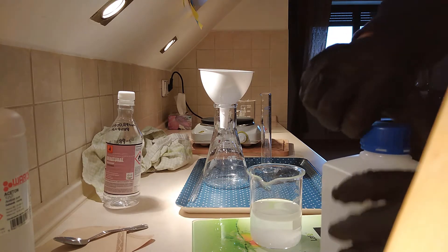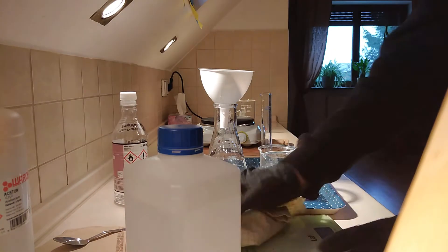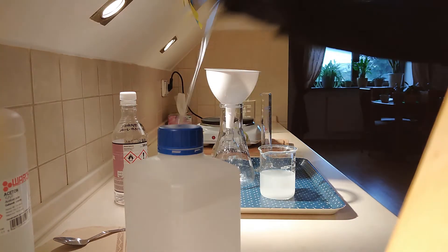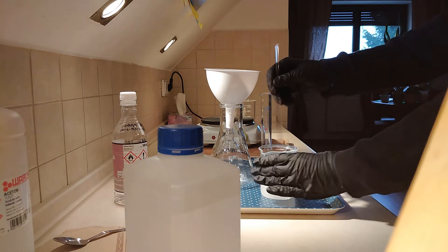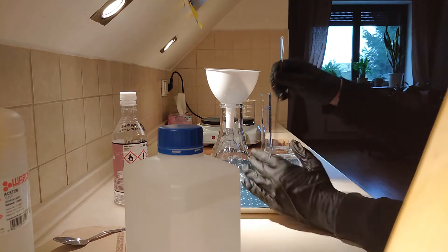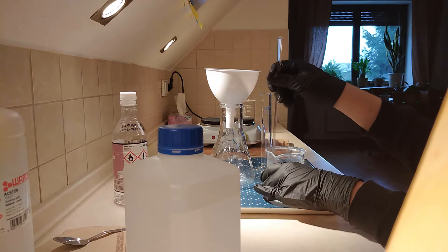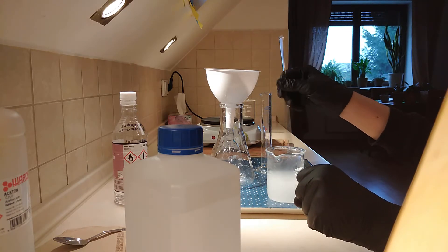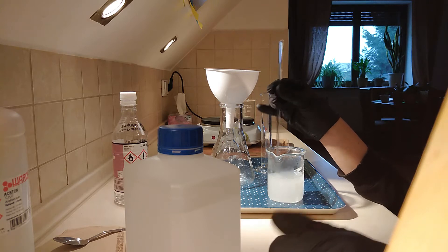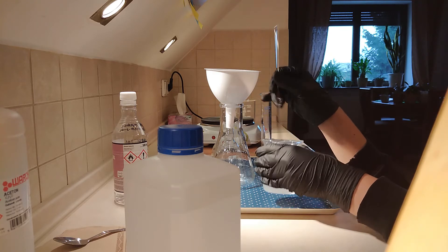I'm going to use a scale for this prep. Let's dissolve the hydroxide. It heats up the water quite a bit and makes it steam. But don't worry, these steams are water vapor, not sodium hydroxide. It's nearly dissolved.